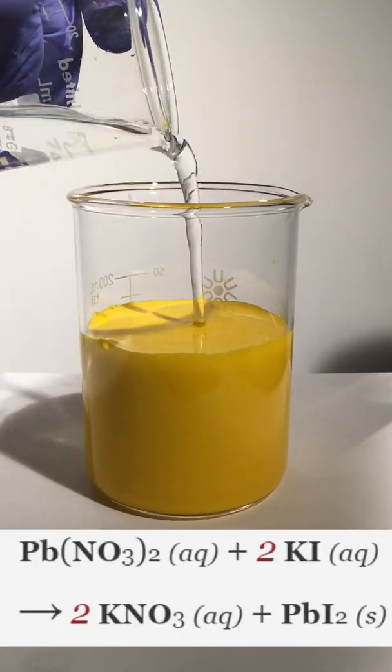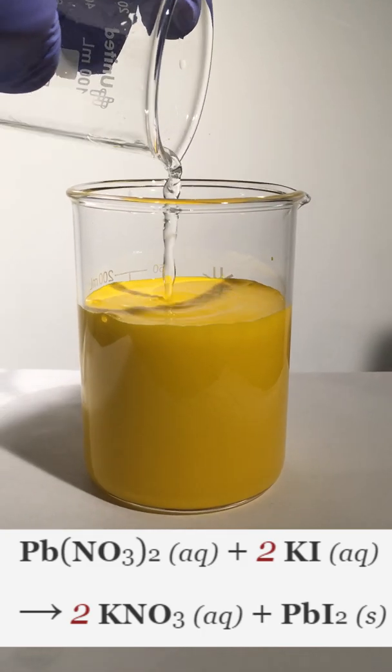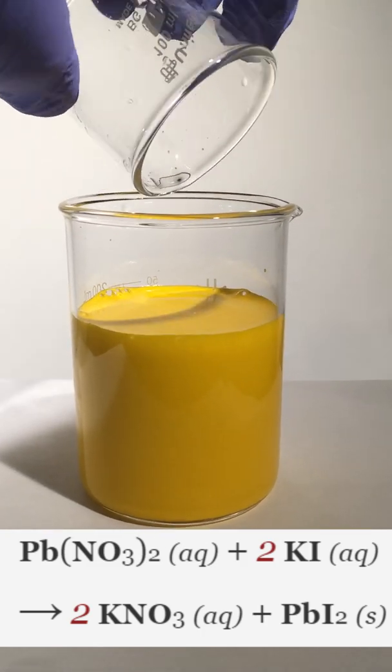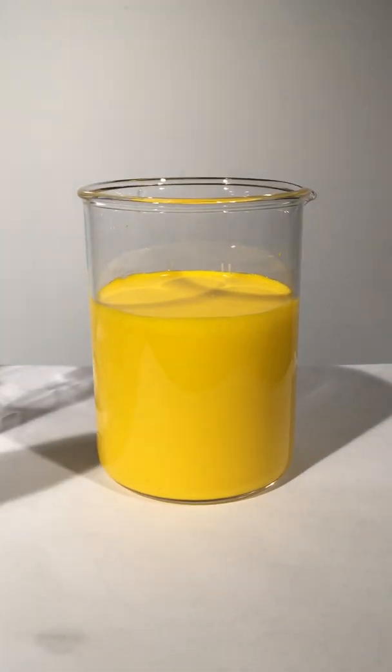This is an irreversible chemical change because a new compound was formed. This chemical change is known as a precipitation reaction.